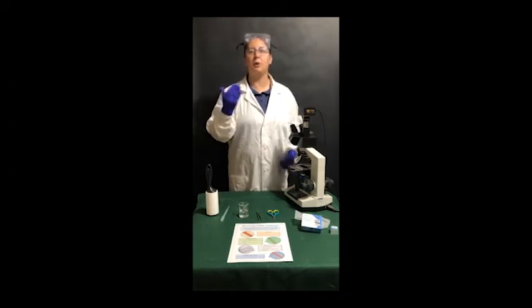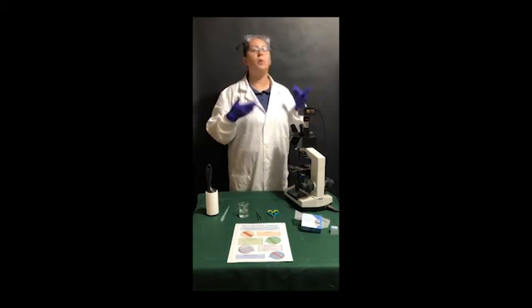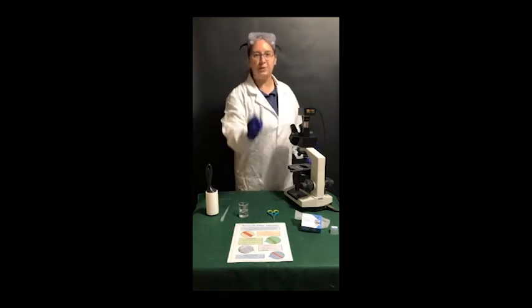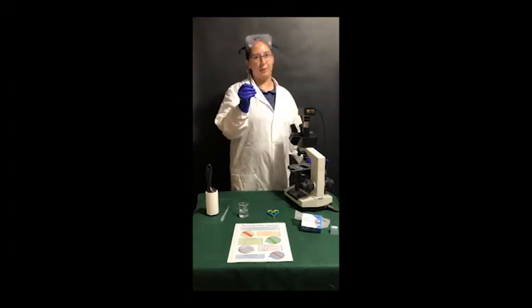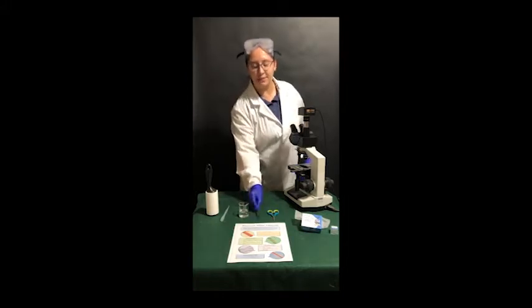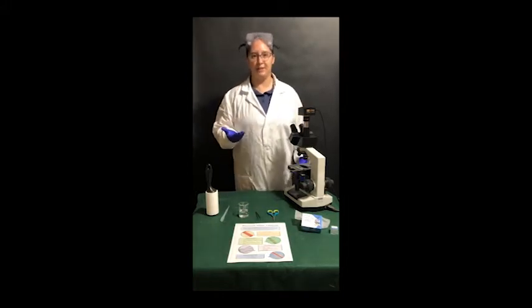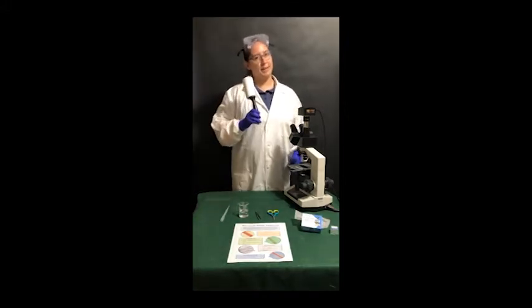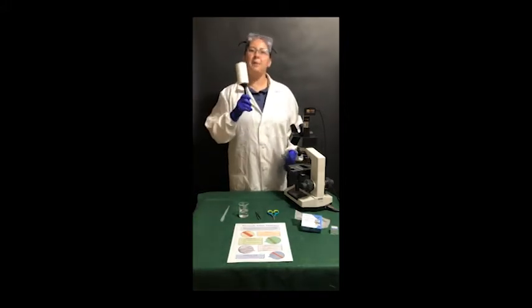Fibers are often collected using tweezers or a vacuum. Tape can also be used, but the adhesive can sometimes be destructive to the evidence. For today I will be using a lint roller just for the sake of demonstration. I'm going to hand this to my assistant so that they can collect some fibers from your clothing.